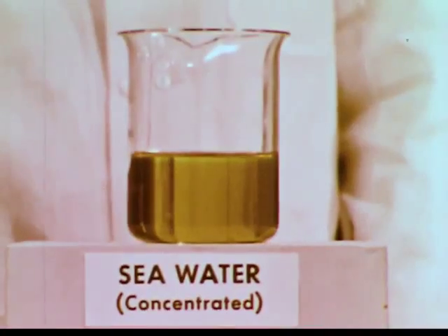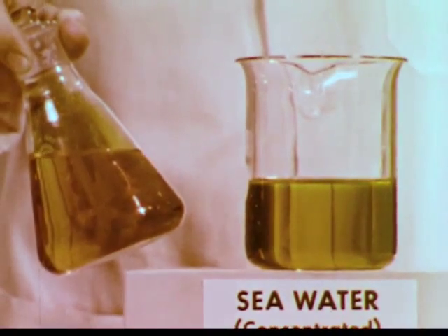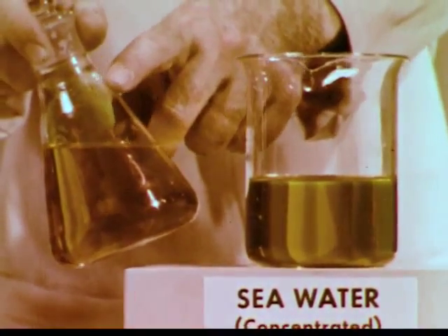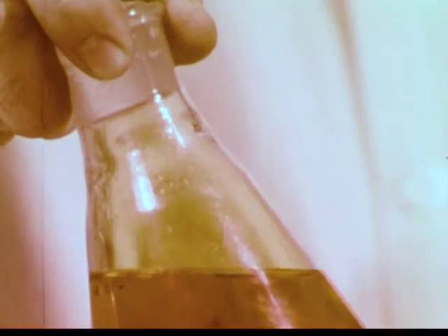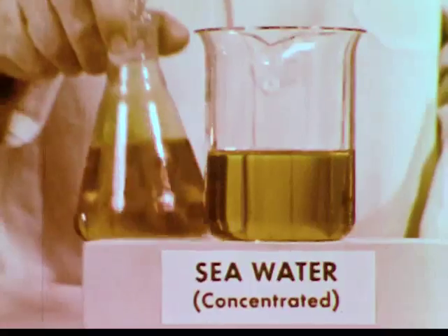Let's compare it with a stoppered flask of aqueous bromine from our earlier experiment. A considerable amount of the volatile bromine has accumulated in the airspace above the solution because of the low solubility of bromine in water. This suggests that if bubbles of air are forced through the solution, they will carry away the volatile bromine.